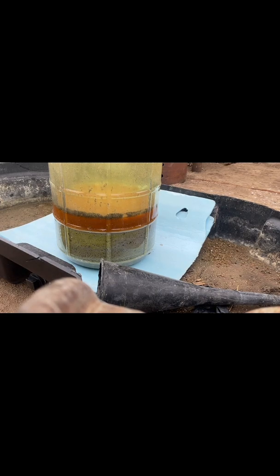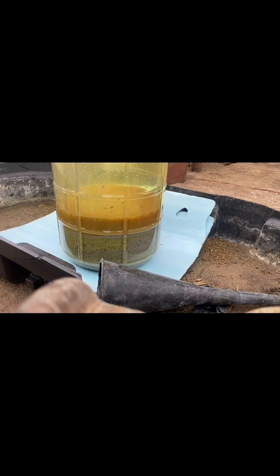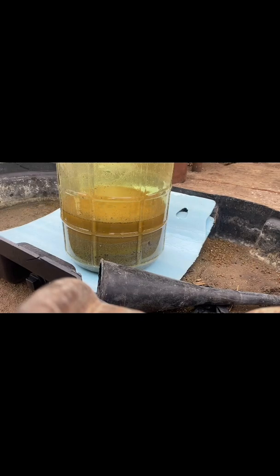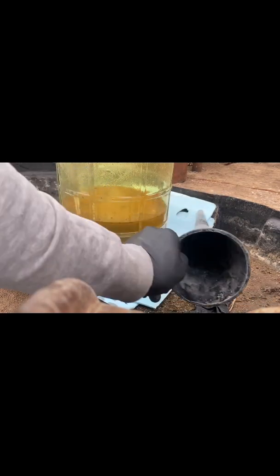Now that we've got enough of that in there for now, let that soak in our solution. Close it up. See all that chlorine gas in there? Let's see how green it is — it's orange now. Once that drops down into the solution, probably about another hour. Every hour I'll add another four or five grams of the calcium hypochlorite as it's starting to dissolve our precious metals.